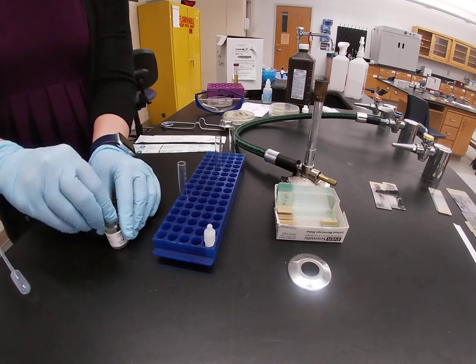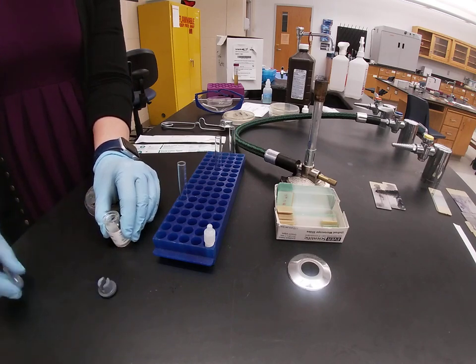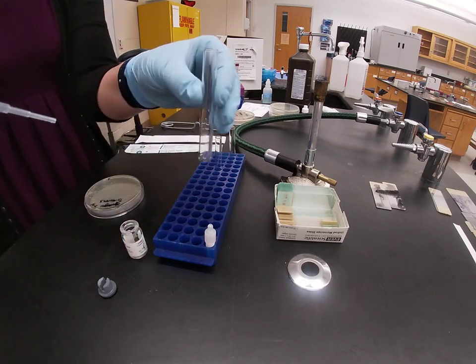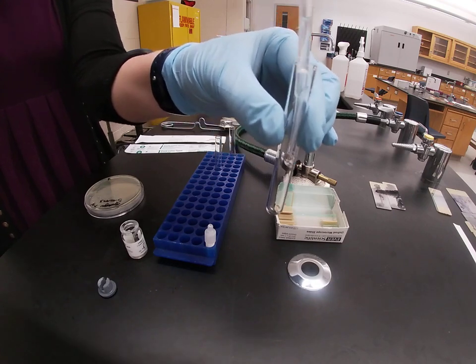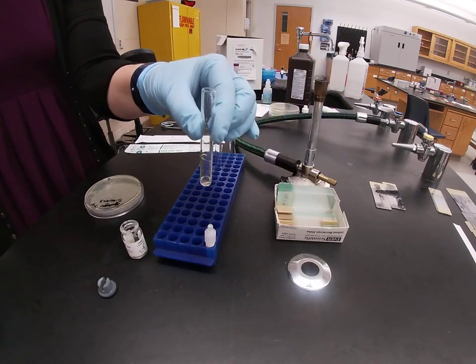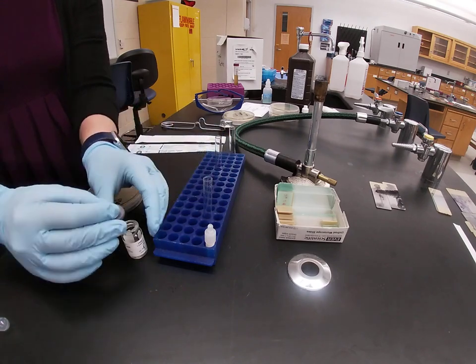So to do a coagulase test, you take your rabbit plasma and you get a transfer pipette, and you are going to transfer a small amount of rabbit plasma into a small test tube. You just need enough to mix your bacteria into. You don't want a whole lot of reagent or it will take too long to show your results.